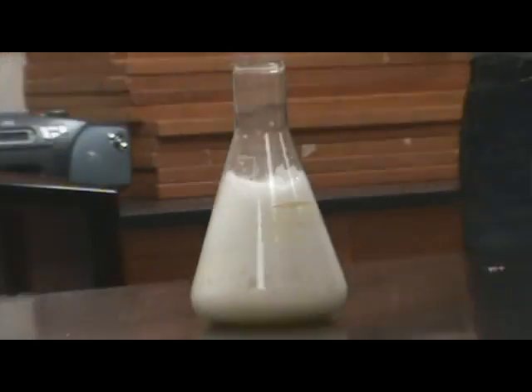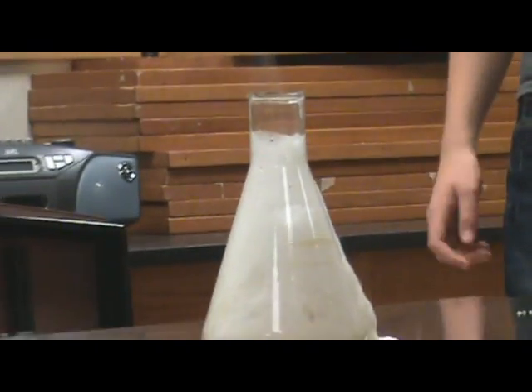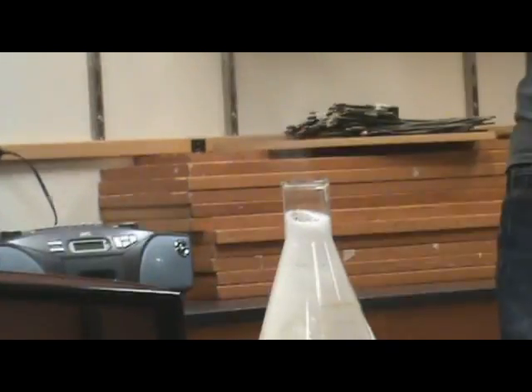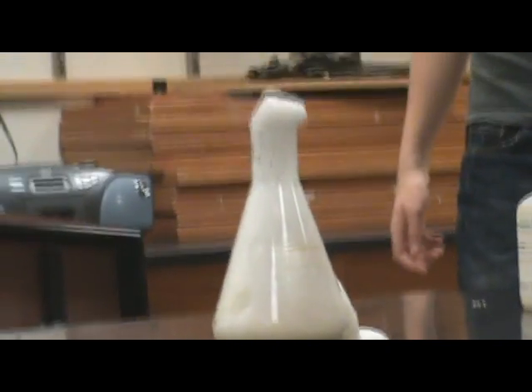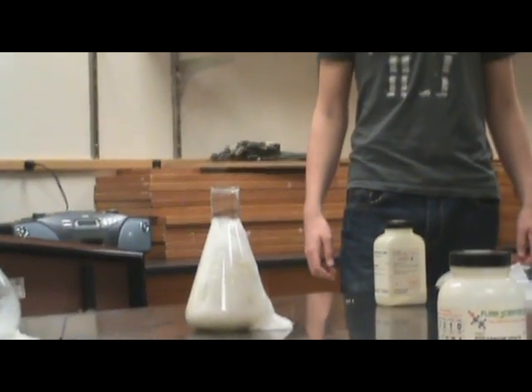Foam's growing. It all overflowed there. That's so cool, it just goes bleh bleh. Keeping it on there. It's very similar to the elephant toothpaste reaction.